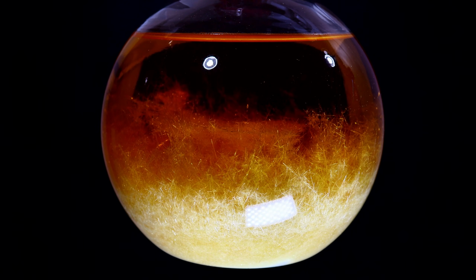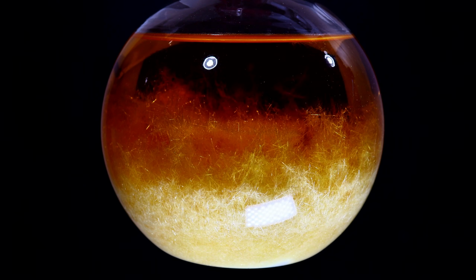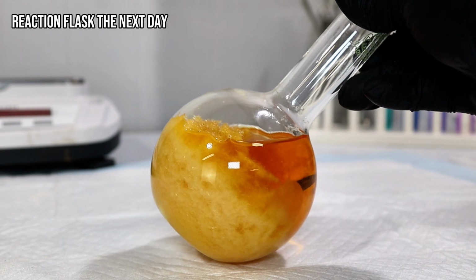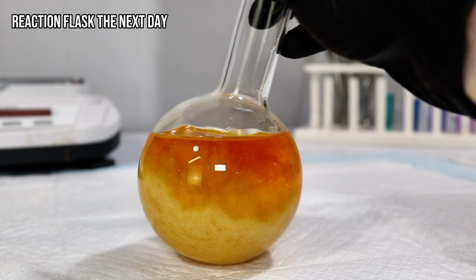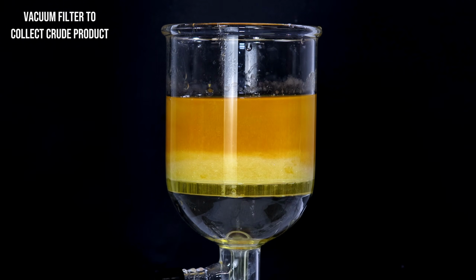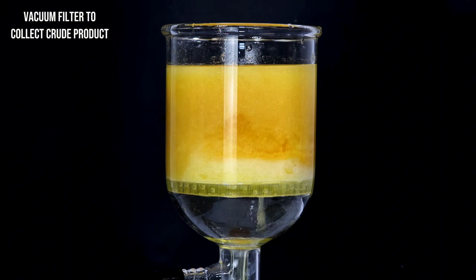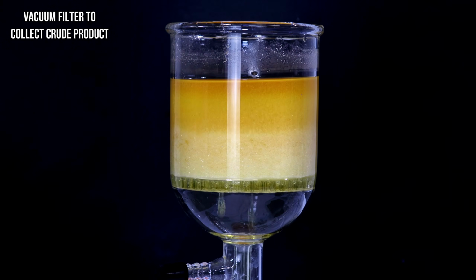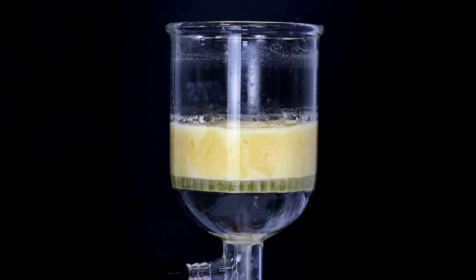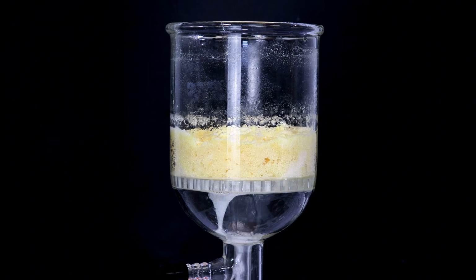Also, if you instead opted to do this step at room temperature, the mixture would have slowly become more viscous and opaque as much smaller benzoin crystals formed over time in the suspension. Neither method is necessarily superior, and after allowing the mixture to cool to near freezing, I simply dumped it directly into my Buchner funnel to collect my crude benzoin. If you prefer smaller fluffy crystals, this could have alternatively been dumped into an ice bath while still hot and then vacuum filtered.